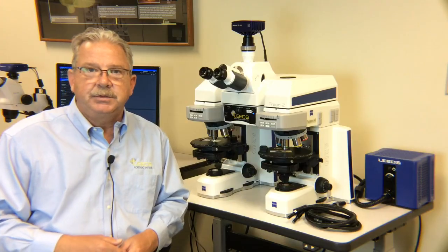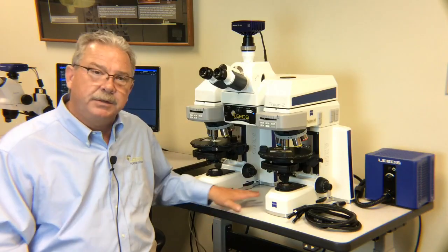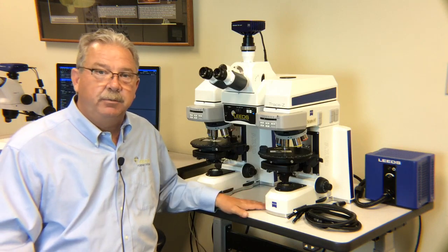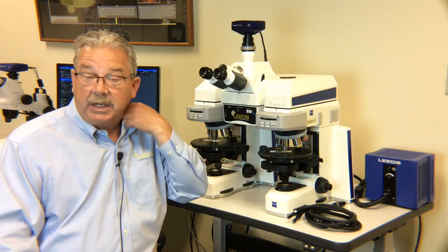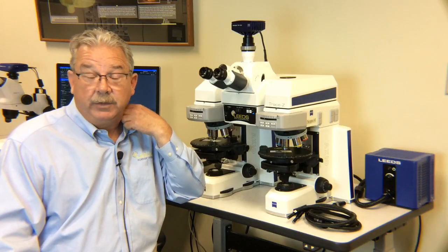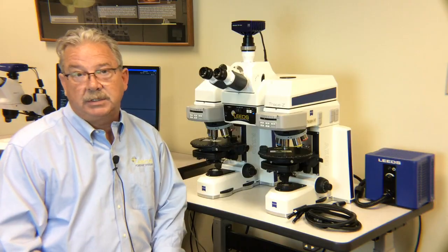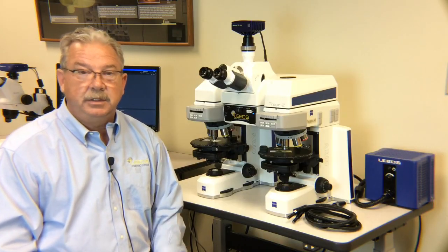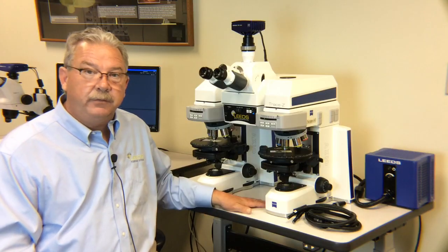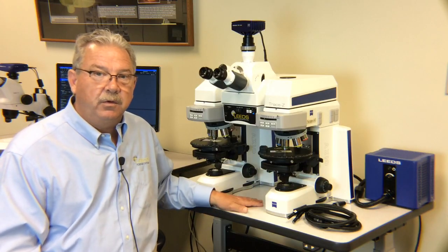Different people will use the comparison microscope to a different degree. We have some customers that have their comparison microscope and all they do is bright field work, and then they will have a second microscope, a single freestanding microscope, that they might do some of their polarized light or fluorescence work there. One of the things we offer is the unique ability to do all of those techniques on a comparison microscope if you choose to go that way.